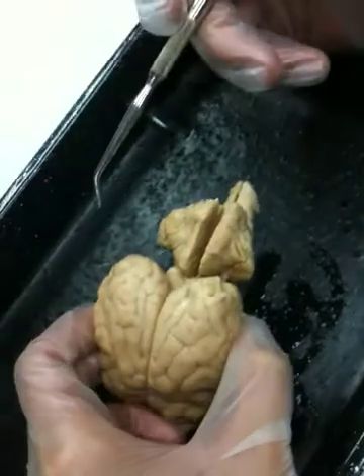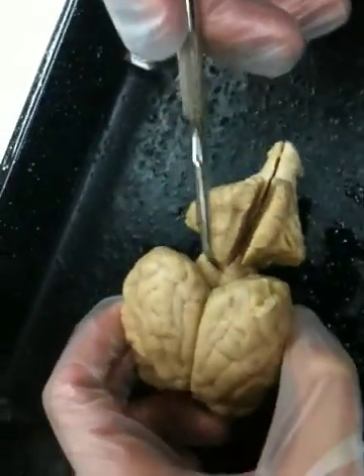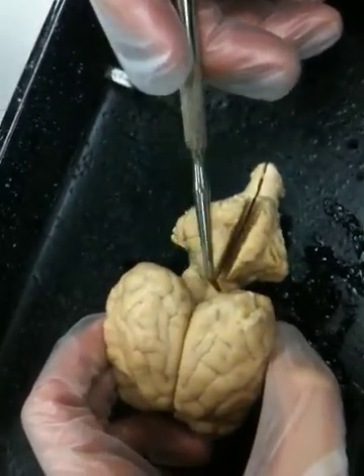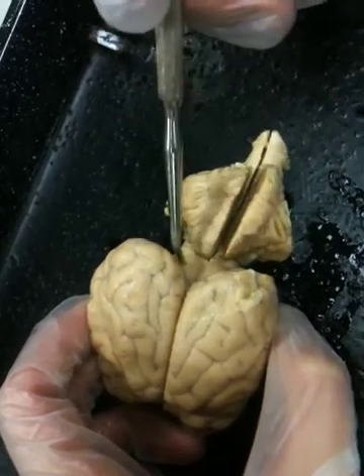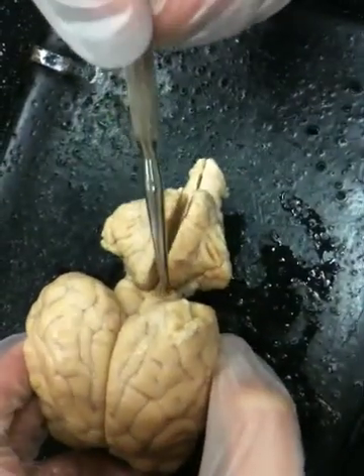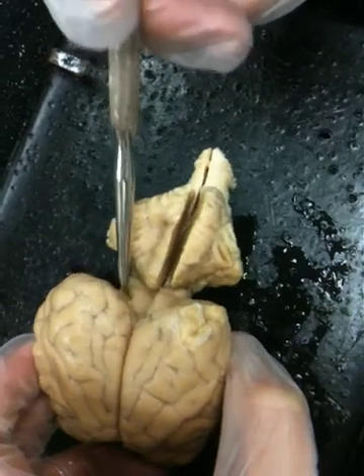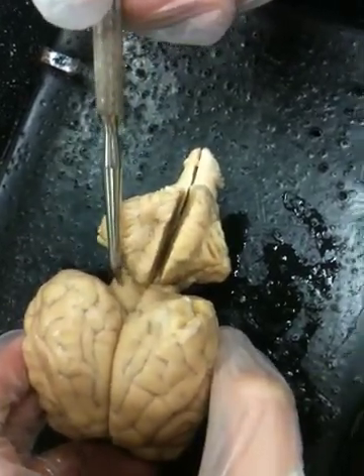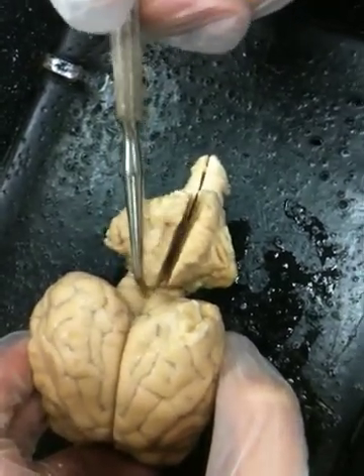In there we have a superior colliculus, this large rounded body here, and an inferior colliculus, this smaller body right here. I'll turn the brain back around so that we're looking at the sagittal section, and you can see where those are. The larger butt cheeks, we call those the superior colliculi, and the two smaller ones down there, the inferior colliculi. That is one half. Corpora quadrigemina means all four of them together, two superior colliculi, one from each side, so we need the whole brain together.